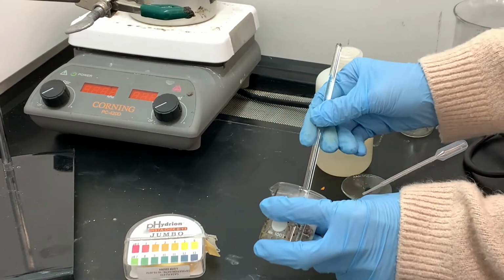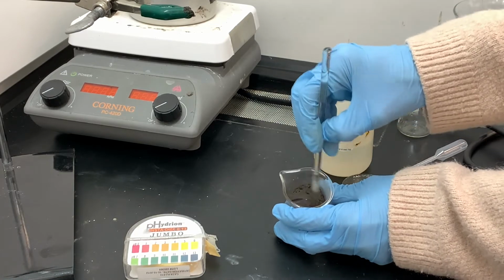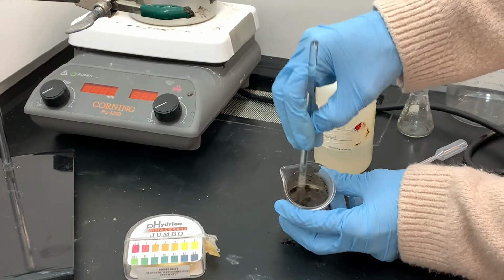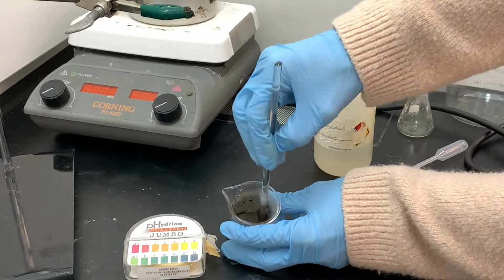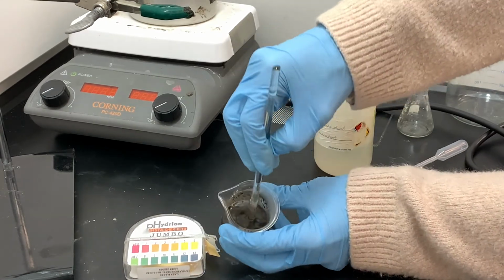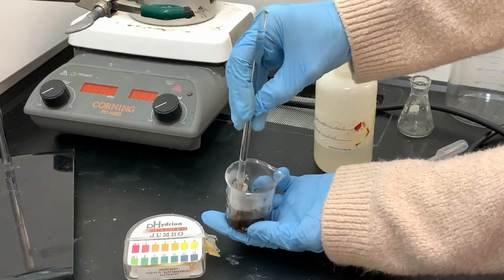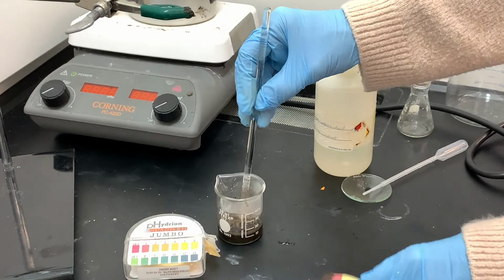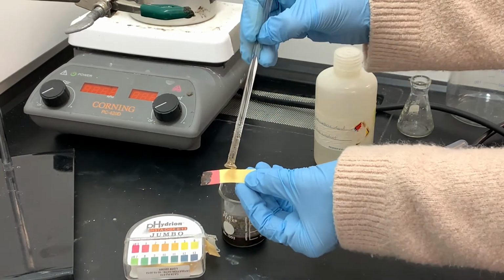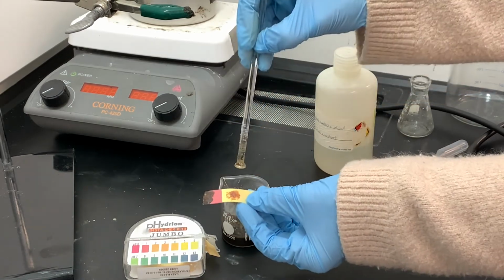Remember that the manganese dioxide, MnO2, is not very soluble in water, so that's the brown chunks that you see sticking to the inside of the beaker, and I'm trying to mush those down into the liquid and get it all mixing together really well. Remember that this reaction between MnO2 and sodium bisulfite needs acid, so I need to be checking the pH as I'm doing this to make sure that the solution is sufficiently acidic so that this reaction can take place.